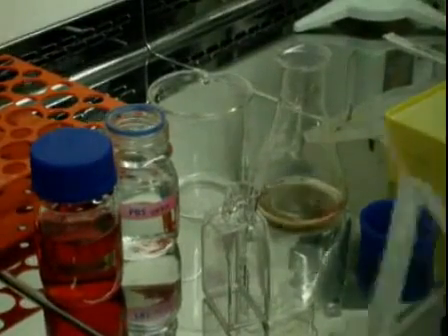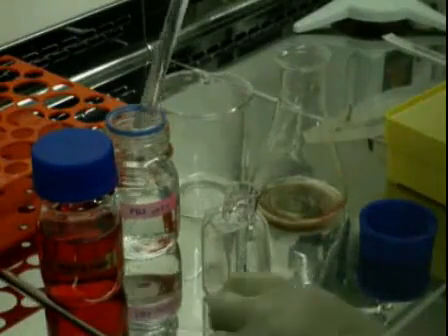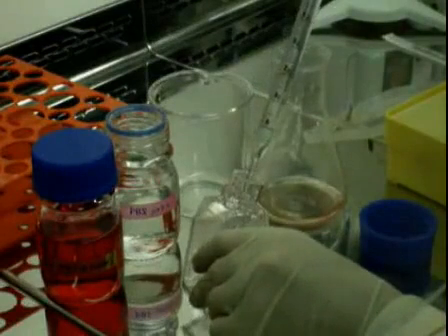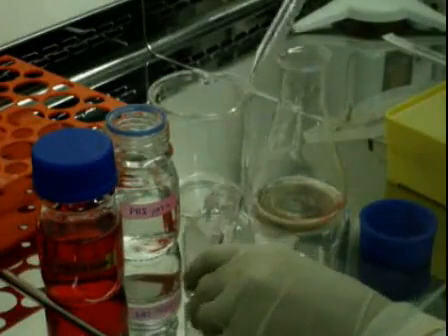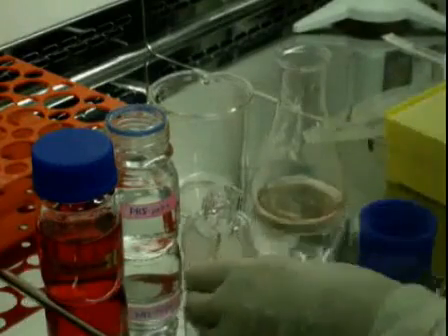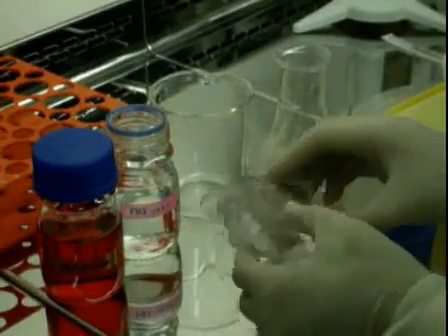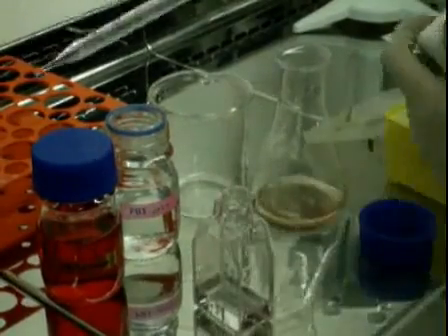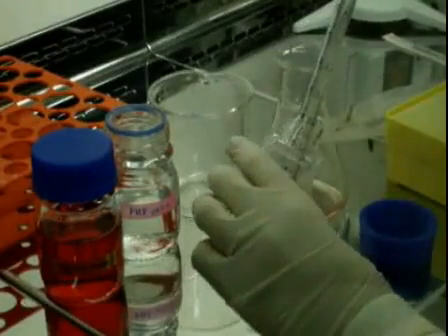Now, with the new pipette, I wash the cells. I mix it gently. And I remove the PBS completely.